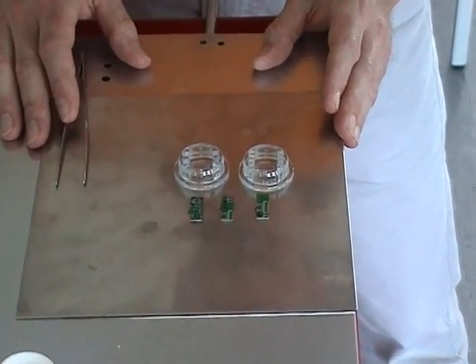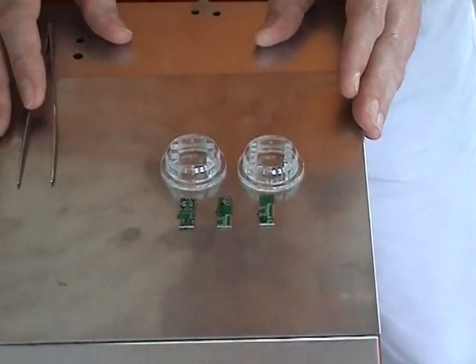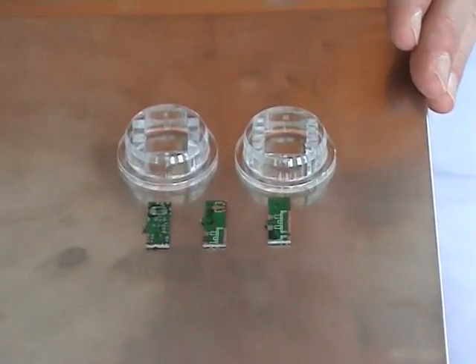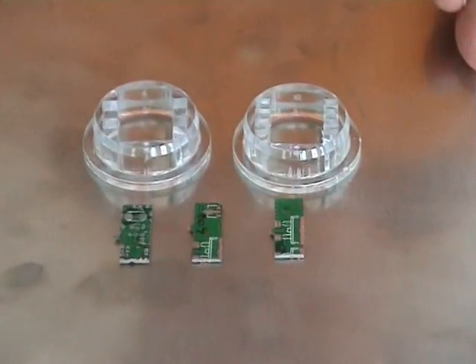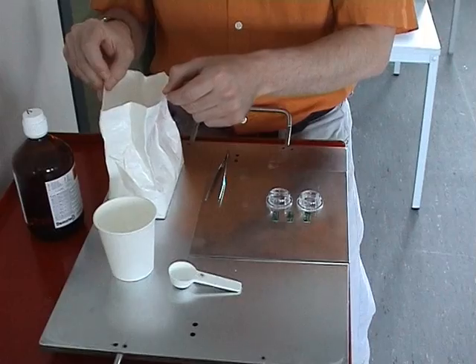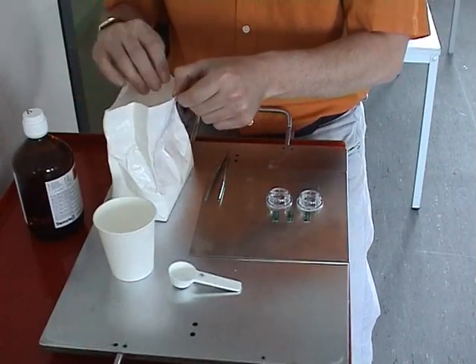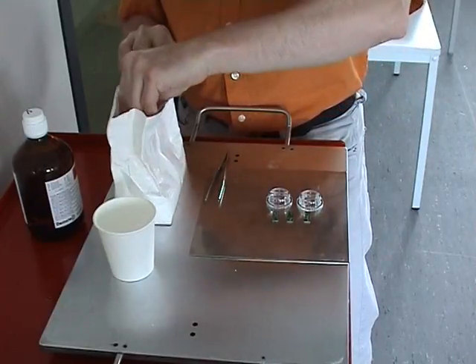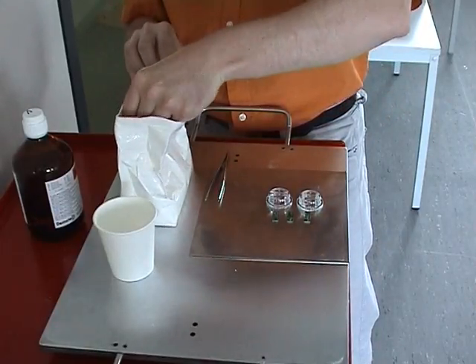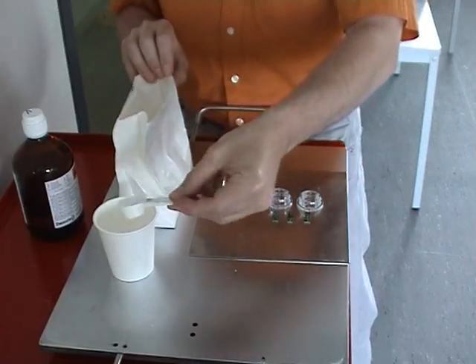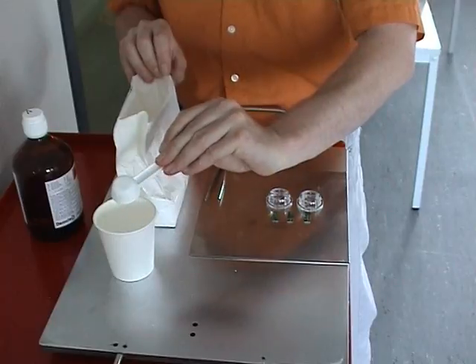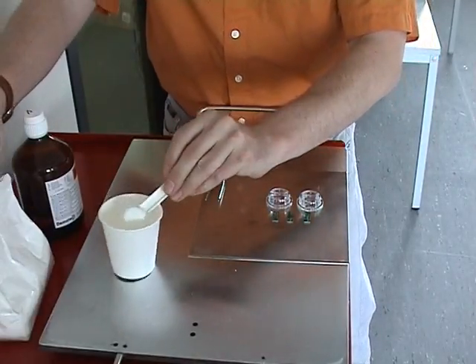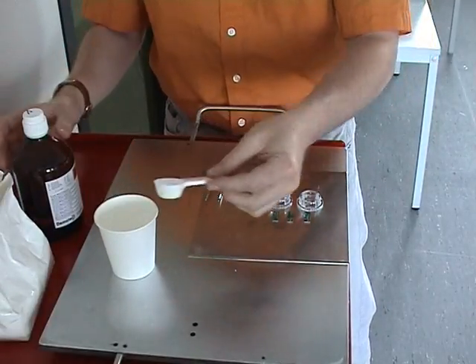The perfect specimen can now be embedded in special fixtures. For embedding, you can use a two-component system, which is a liquid and a powder.